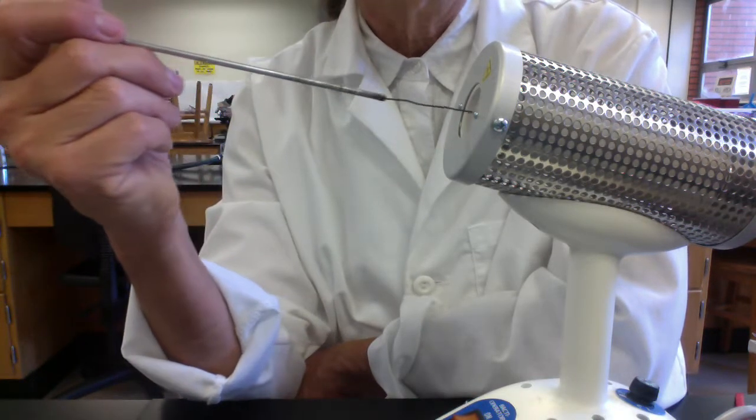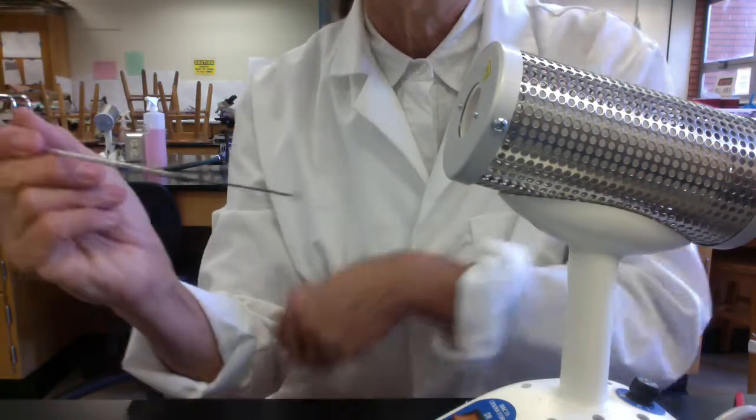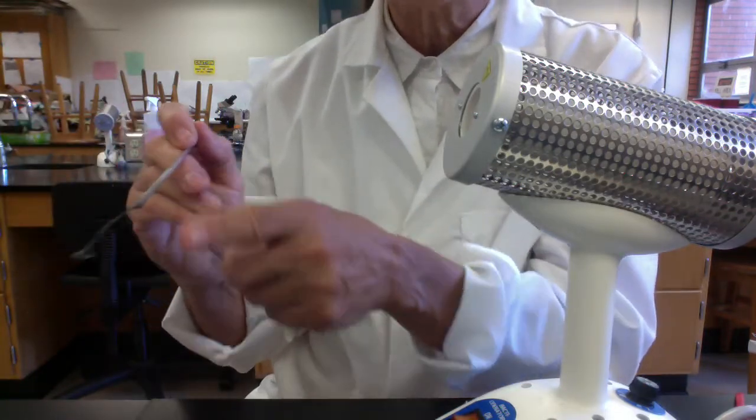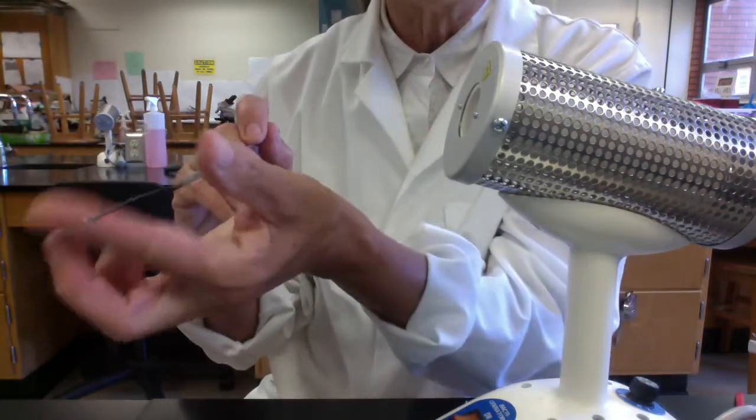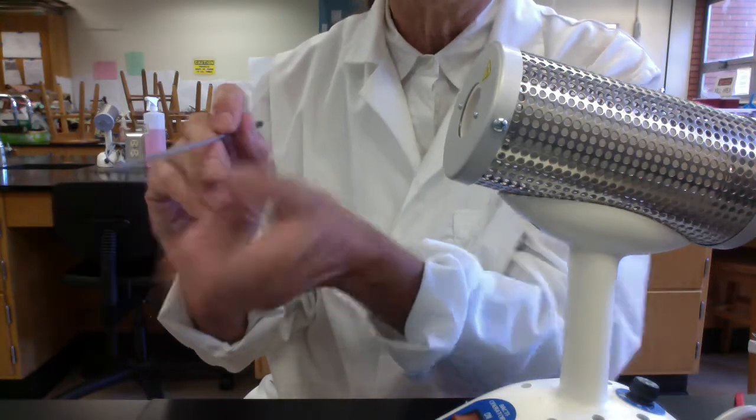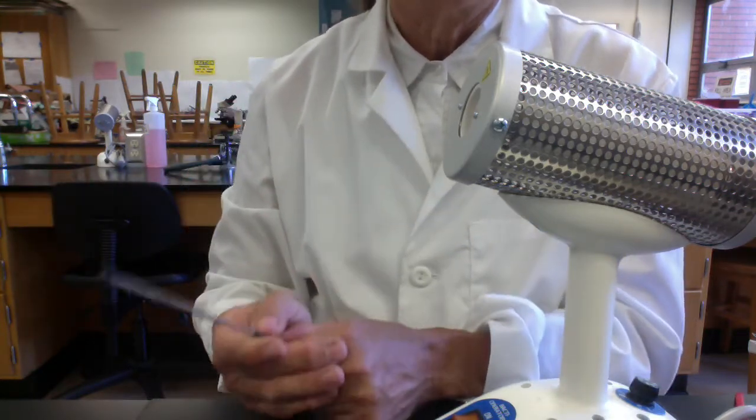When you withdraw the loop, remember all of this portion will be hot. So don't grab it, don't grab your loop here, don't grab it there. Always handle it by the very end.